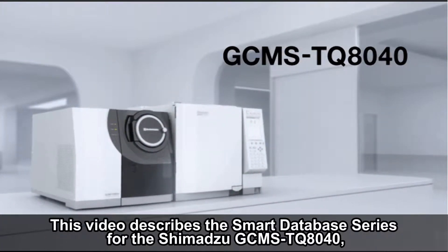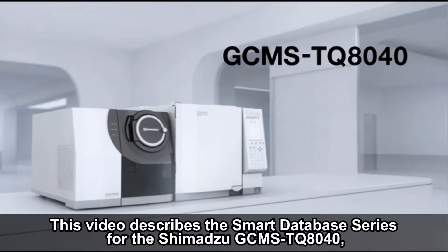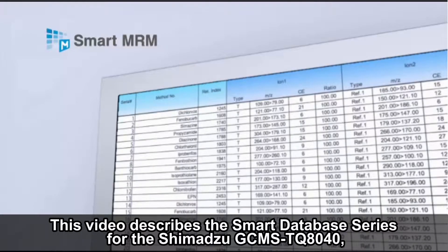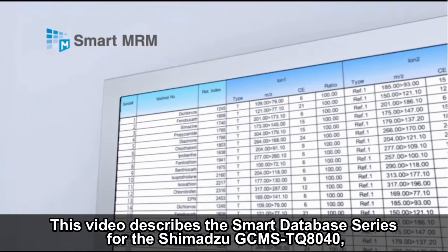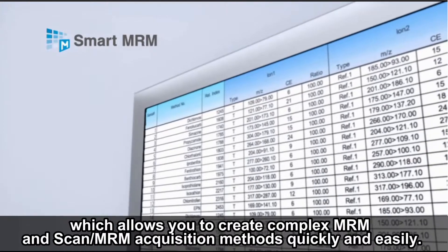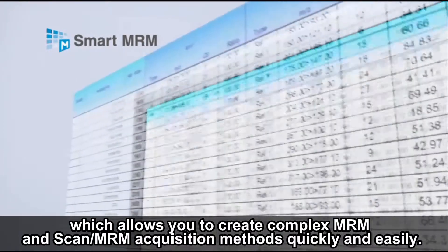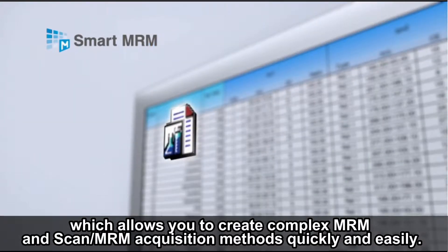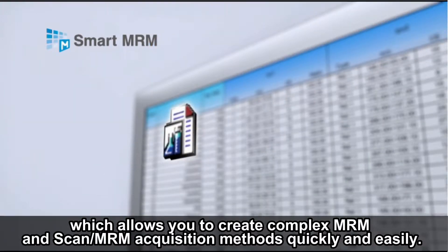This video describes the Smart Database series for the Shimadzu GC-MS TQ8040, which allows you to create complex MRM and scan MRM acquisition methods quickly and easily.